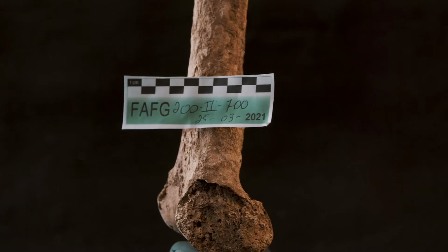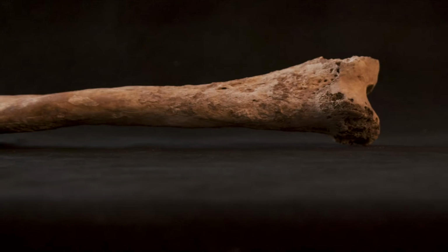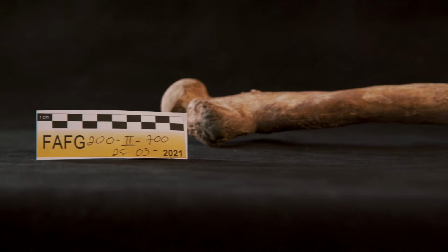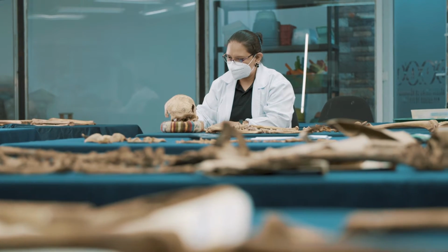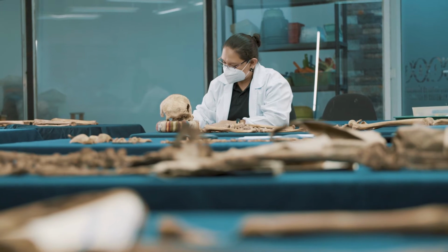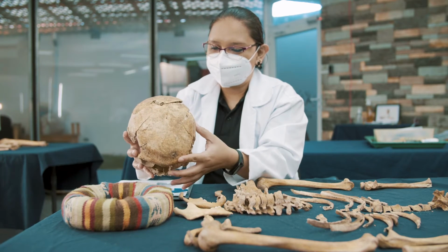Finally, a thorough examination of the dentition will be made, with the aim of finding pathologies, defects, dental work, and any particularity that can be described as an individualizing feature of the victim. The determination of circumortem trauma, for example, injuries that possibly caused or contributed to the death of the victim, is an important part of the analysis performed in the laboratory.